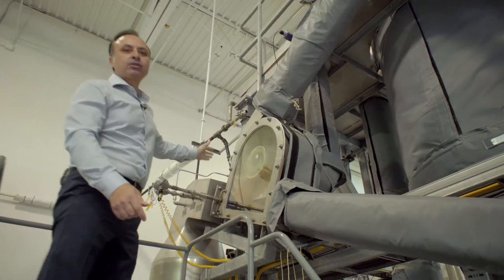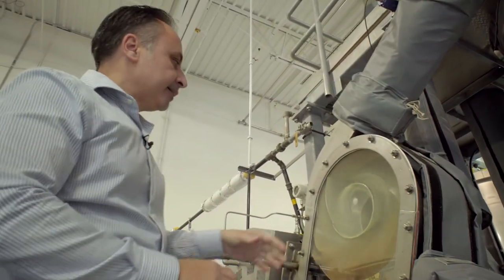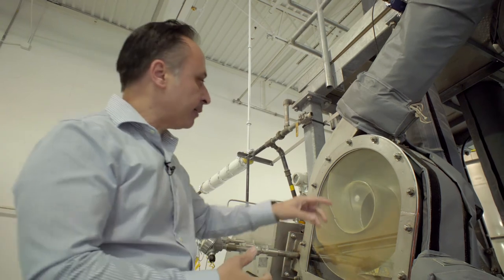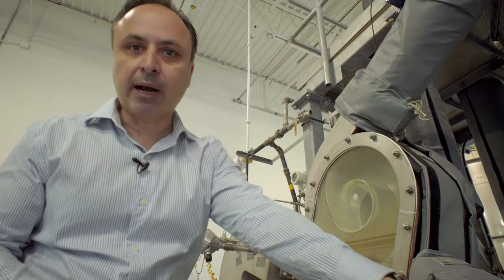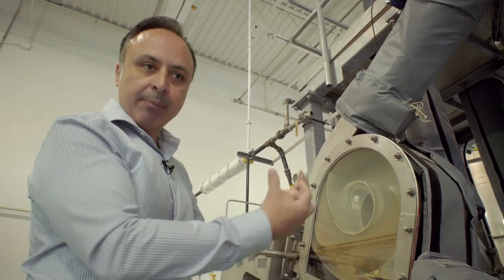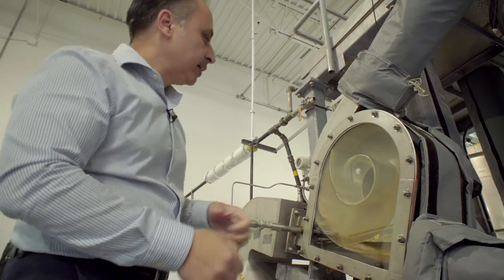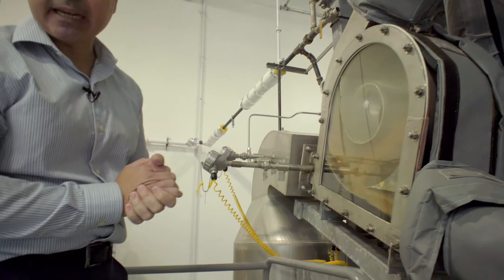Once it makes the loop, it enters what we call a classifier — specific to the ring dryer. The classifier works by centrifugal force. The heavier or bigger particles that enter the system follow the exterior surface of the ducting and get reintroduced back into the drying system. The finer material, which is less prone to centrifugal force, gets circulated around and conveyed into the cyclone for product collection. On our drying system, we use a natural gas burner as a heat source for drying.